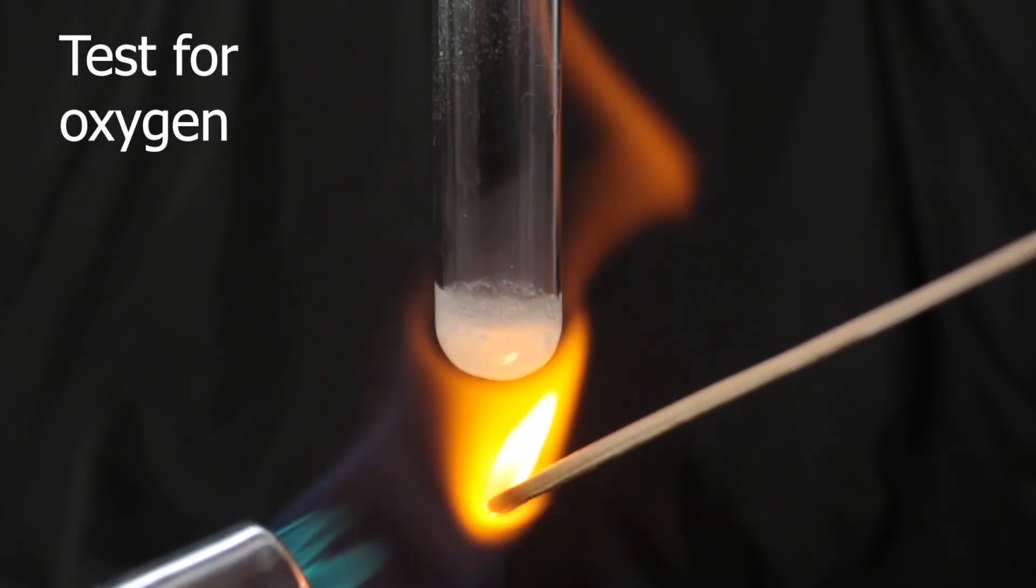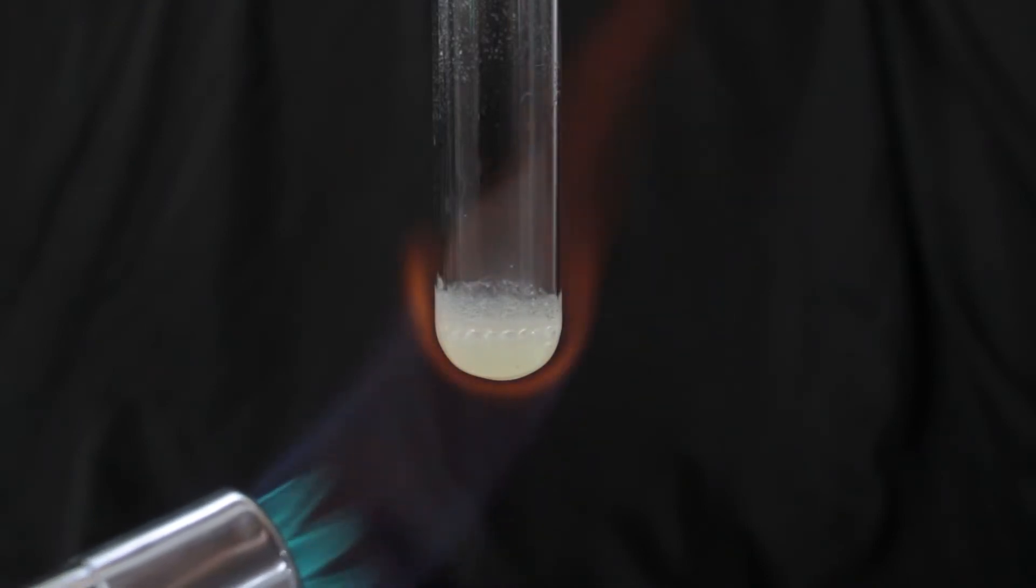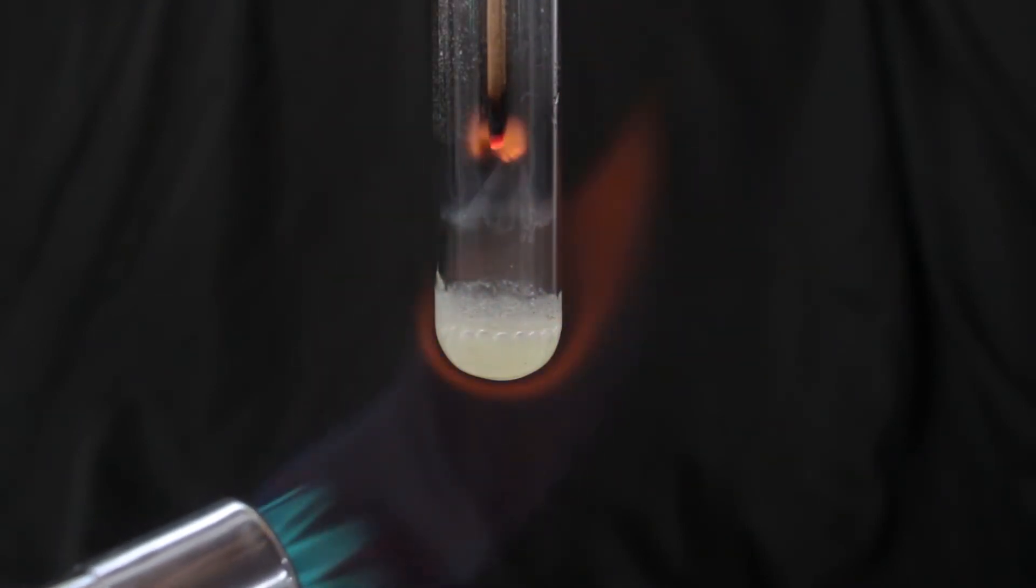Let's check whether it's really true by making tests for oxygen. The glowing splint relights, which confirms that there is oxygen present.